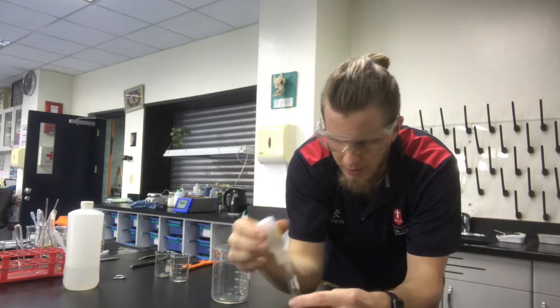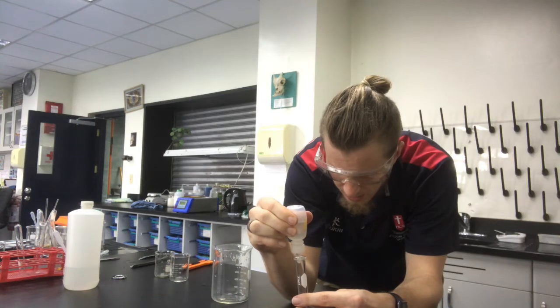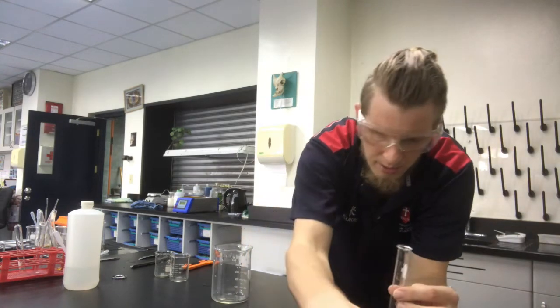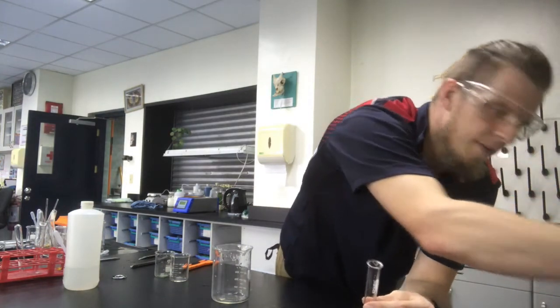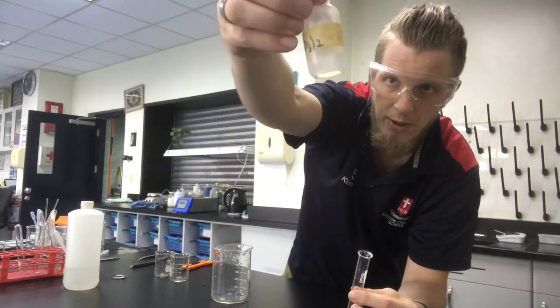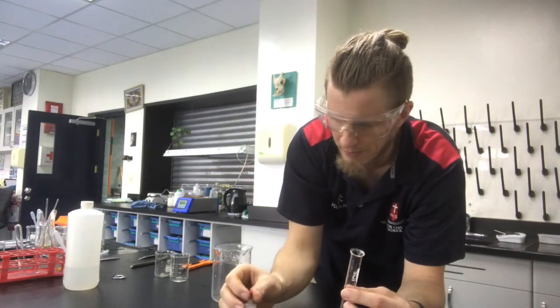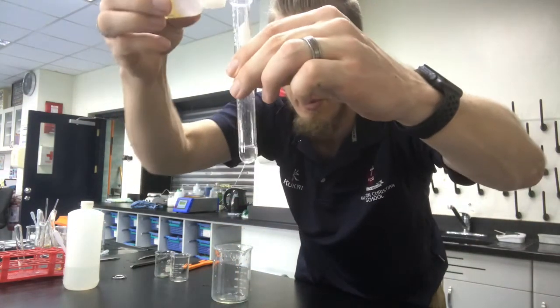I'm going to put a bit of that in my test tube, like so. I'll put that off to my side, and then here I've got some lead nitrate, also a colorless solution. We're going to drop that in there, and we'll see what happens.